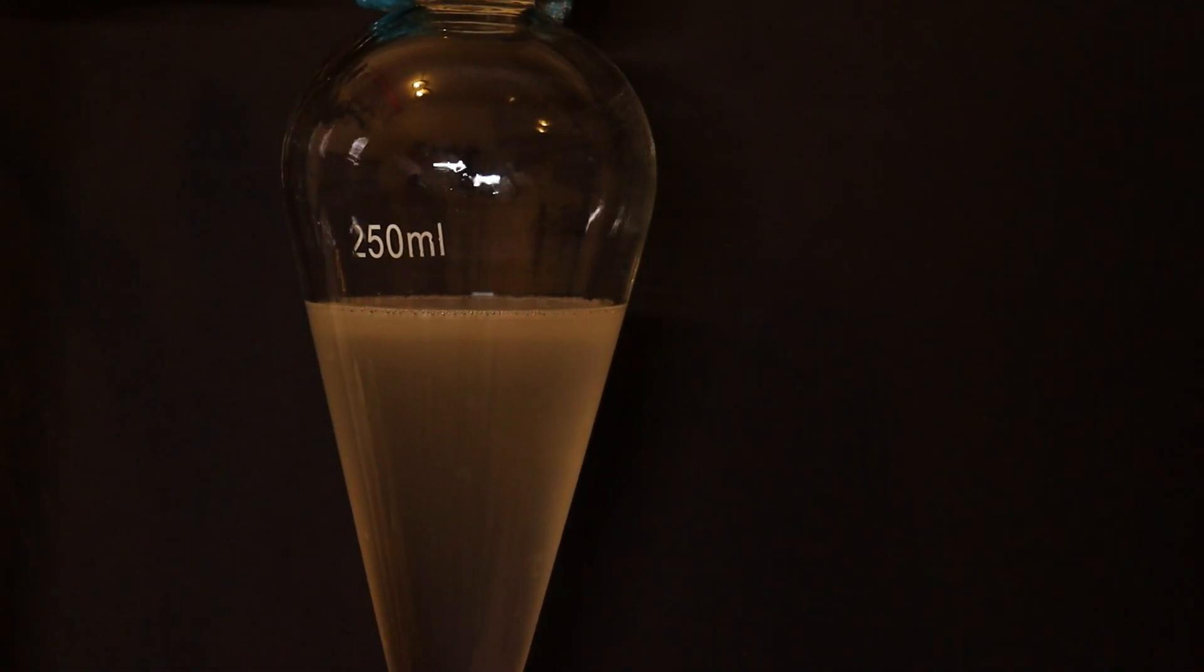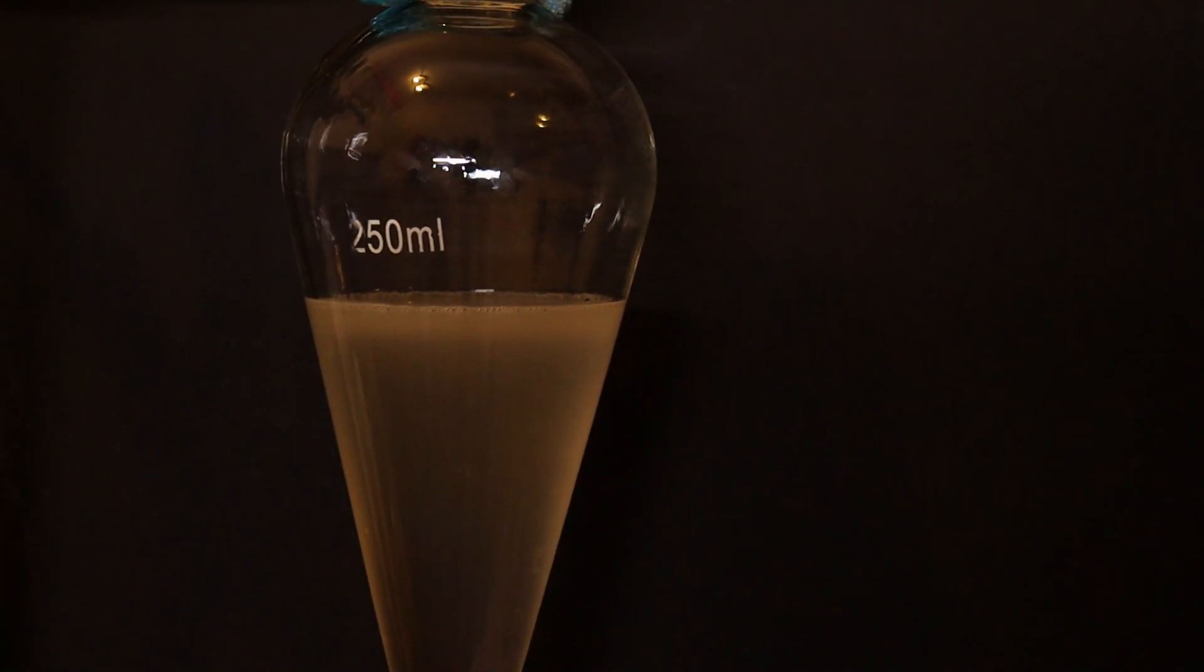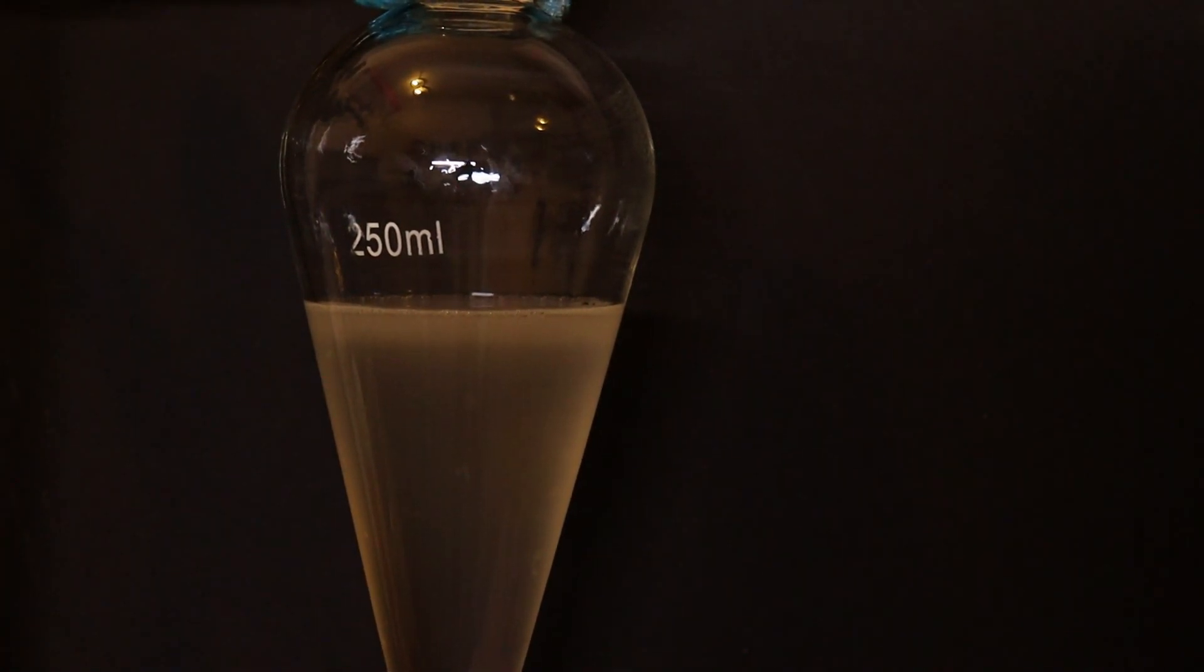It very quickly reacts with the acid to form our desired product, tertiary butyl chloride, which floats to the top.